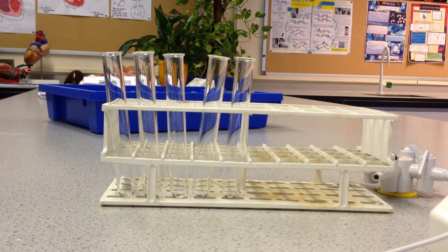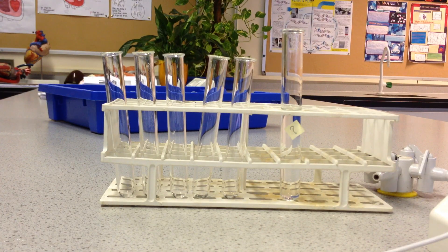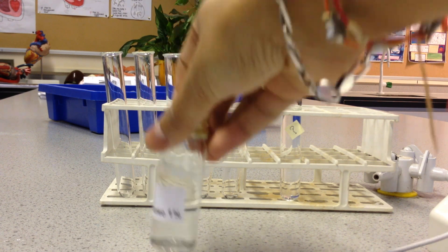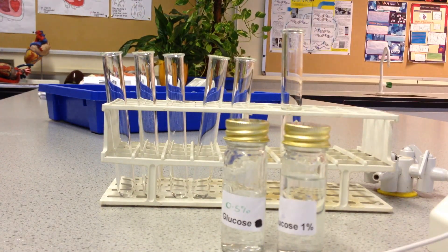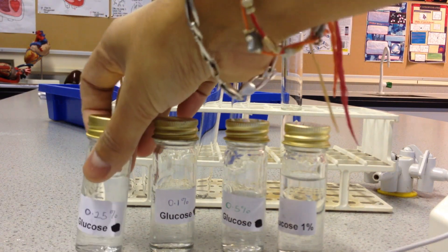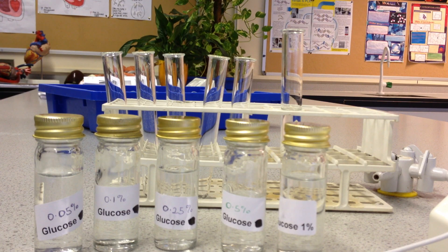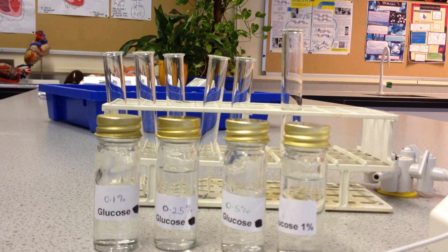So how do we go about it? Here we have the unknown solution with the question mark. I don't know the concentration. What I need is a series of solutions of known concentrations: 1%, 0.5%, 0.25%, 0.1%, and 0.05% — a range of solutions all with reducing sugar in them. Then I repeat the Benedict's test for all of those solutions.